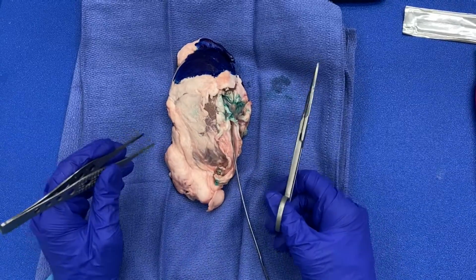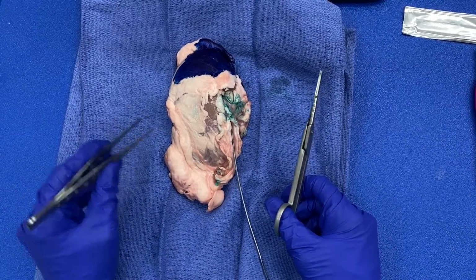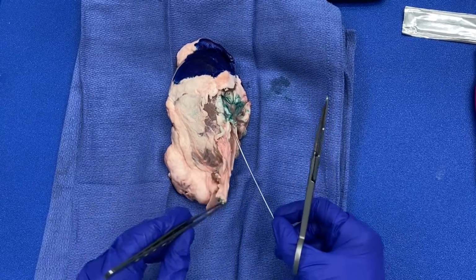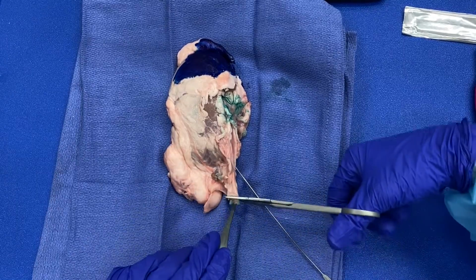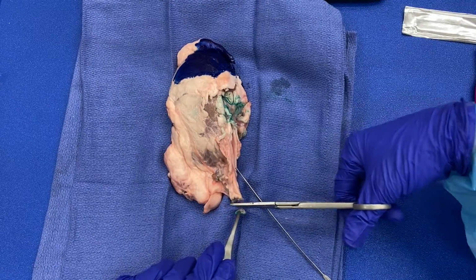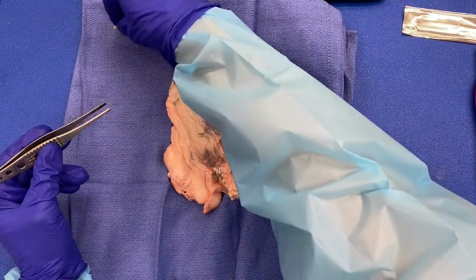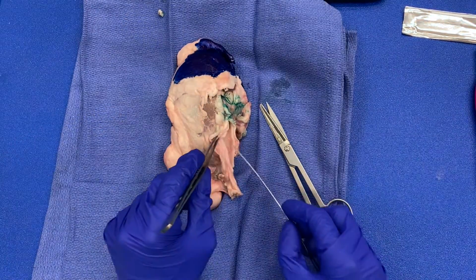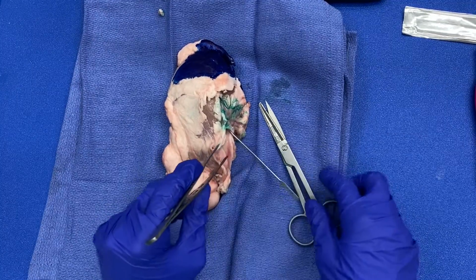Okay, at this point you may also shave your hilar vessels. One way to do that: I've looked at my ureter, there's no tumor, so I'm definitely okay to shave this margin. In this particular case, I'm just going to use my scissors and I will place the ink face down into the cassette. I'll leave my probe in my ureter here.